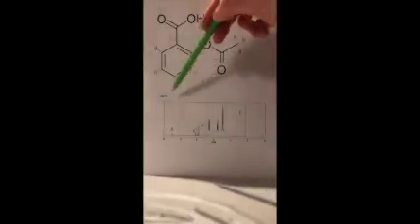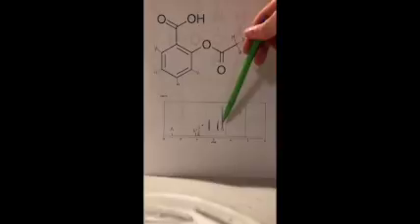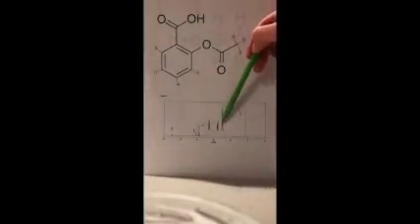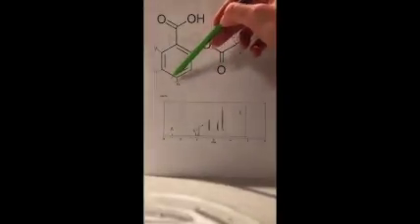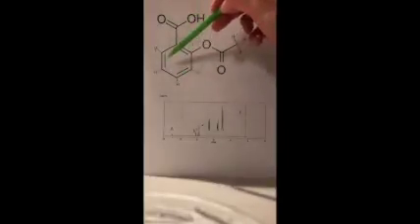So these hydrogens will couple with each other, which generates more peaks in the signal, which is why we see, especially in a ring like this, many multiplets in series, which is another way of identifying a benzene ring. You will have many multiplets in series like this. So that is why we see all of these littler peaks in each signal, because of both the neighboring hydrogens, how many there are, and also the spin-spin coupling between the different equivalent groups.